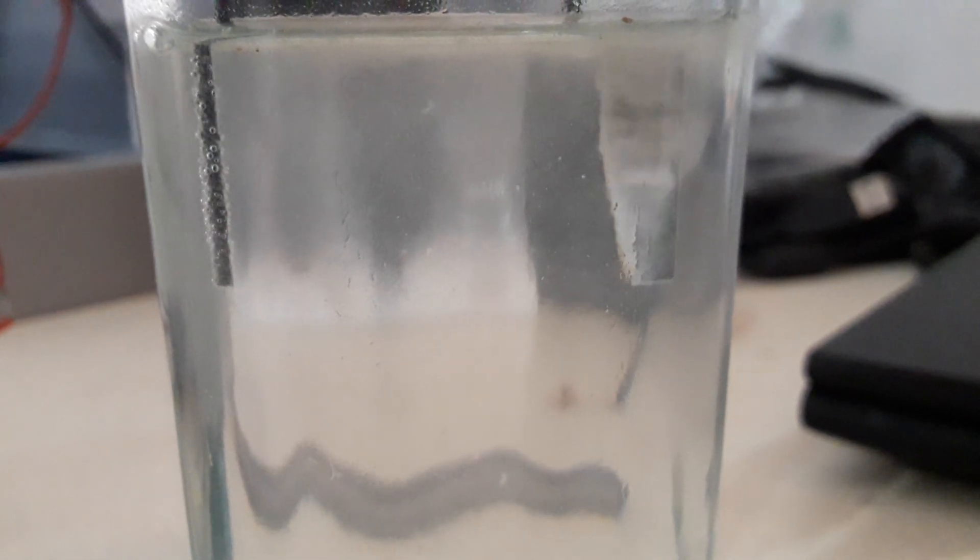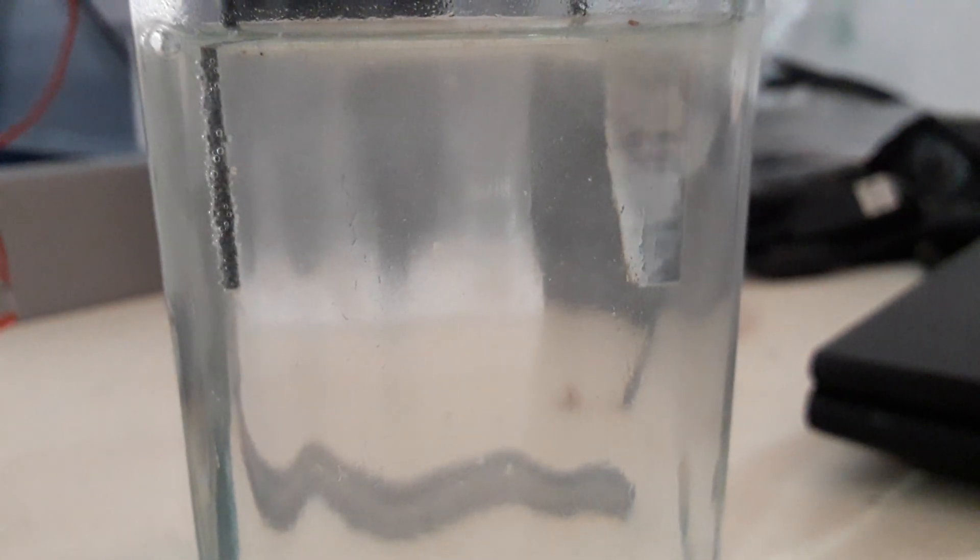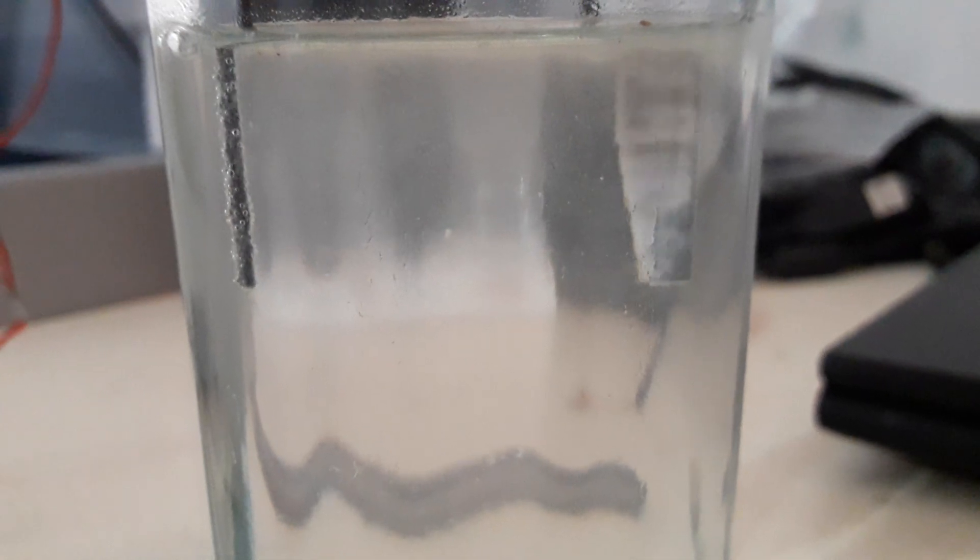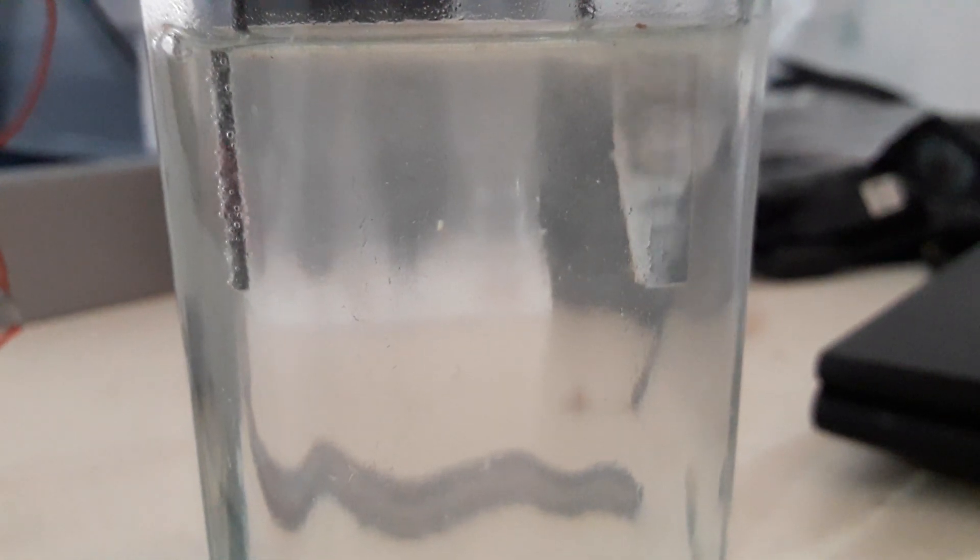See the reaction, how it is going on. We have put the salt because we have taken tap water.